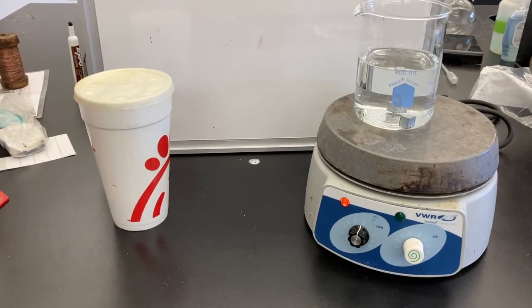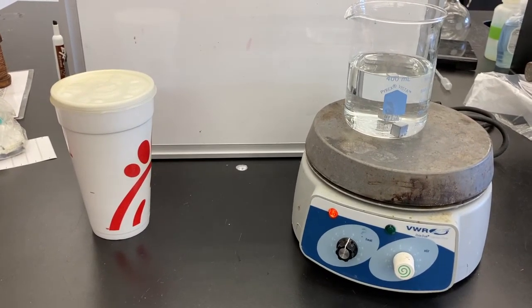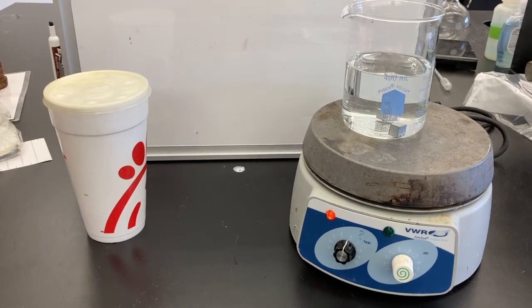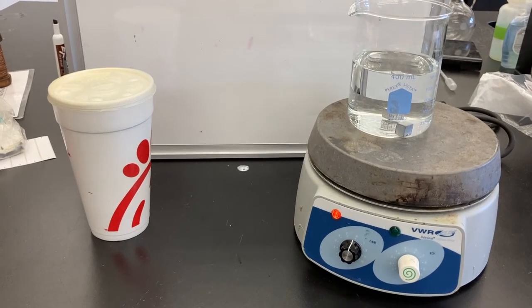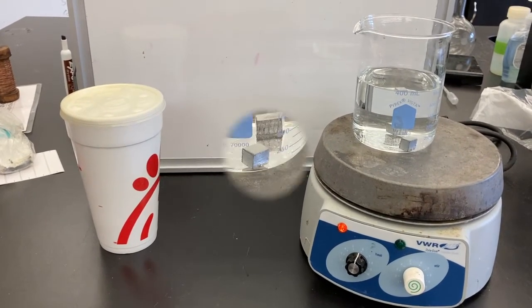Set this aside at your lab station so that it is not right next to the hot plate. We want to keep the temperature fairly constant inside the Styrofoam cup and if we move it closer and farther from the hot plate, it will start to fluctuate even before we add our metal pieces.